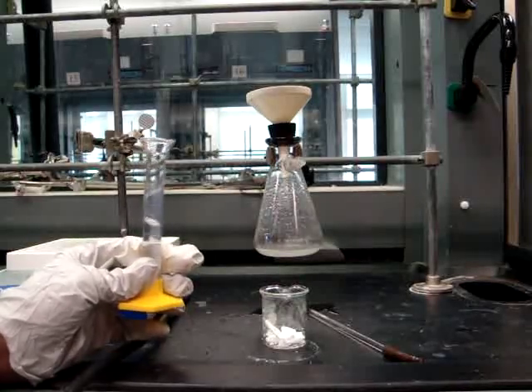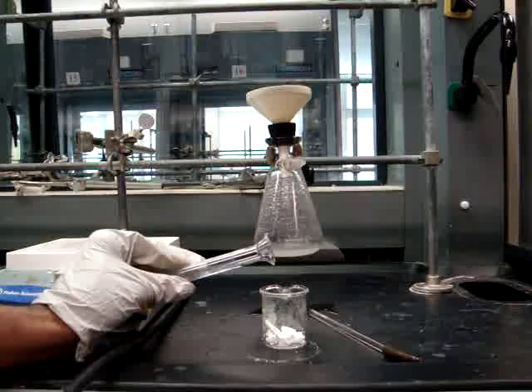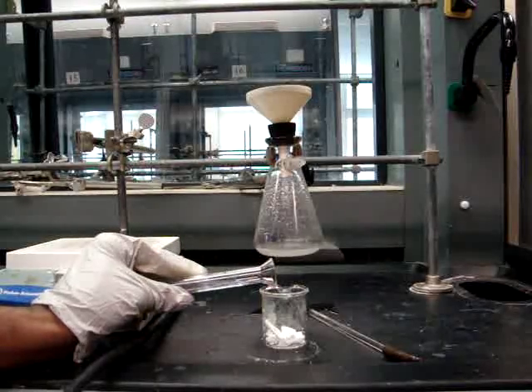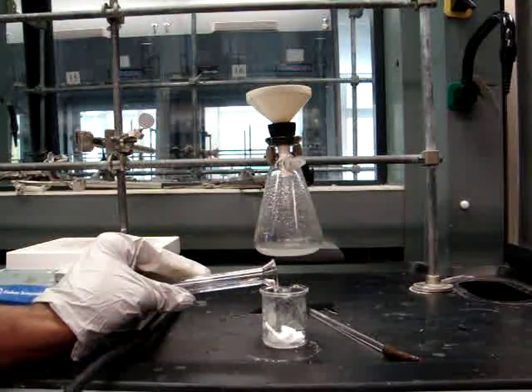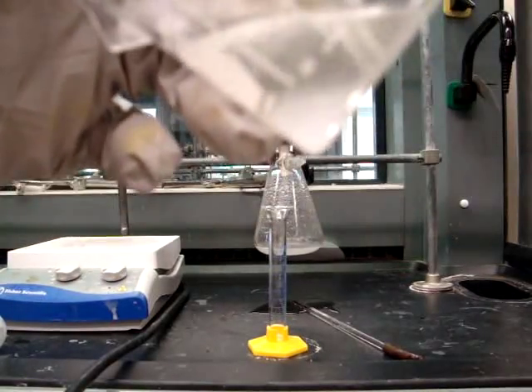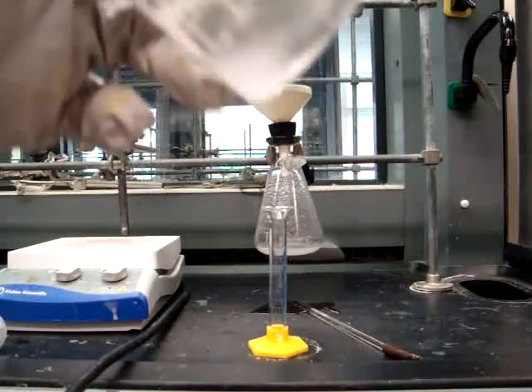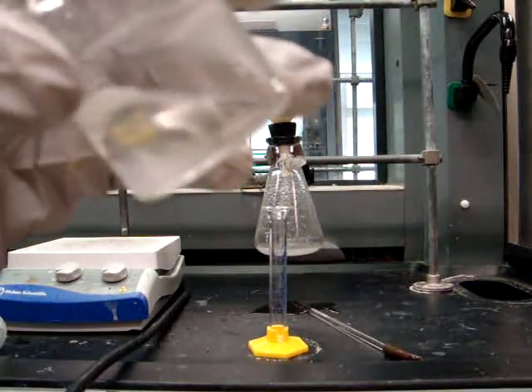When you add your 7ml of diethyl ether, you will make sure that you're adding it extremely slowly to the beaker. The bottom layer that is formed is water, so in order to make sure that your product becomes dry, you need to pipette out the bottom layer.